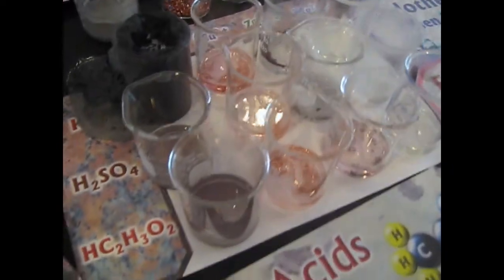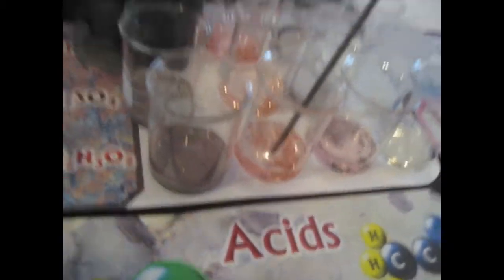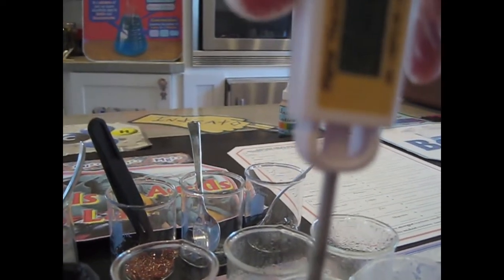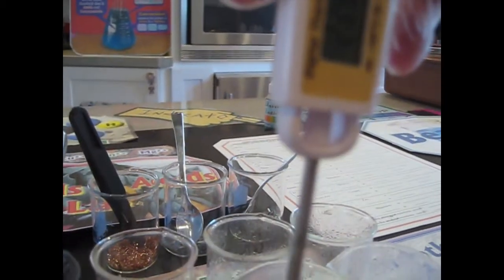Interesting. Okay, and notice the reaction didn't really do that much either. Notice the color, right? Still smells bad. Let's try these ones, the copper ones. Okay, so we're getting 25, 24. Oh, look, it's dropping down. 24, it's going back down. I'd say 23. Yeah, I'd say 24. It's hovering right around there. It's still dropping though.